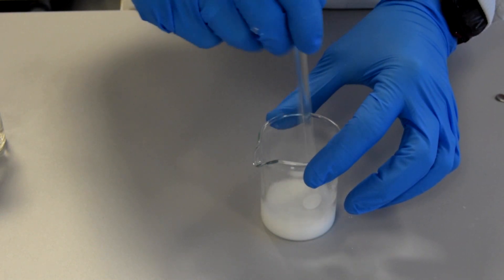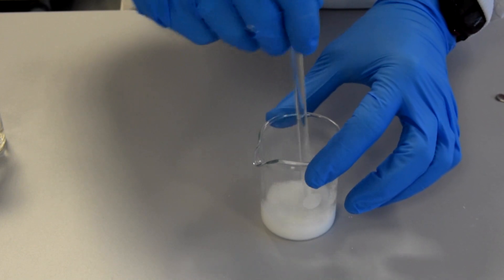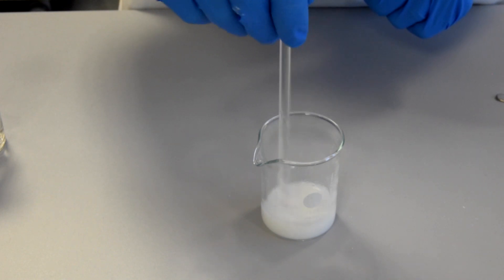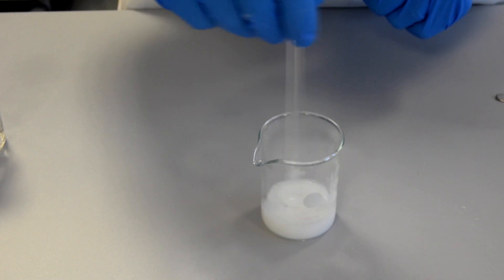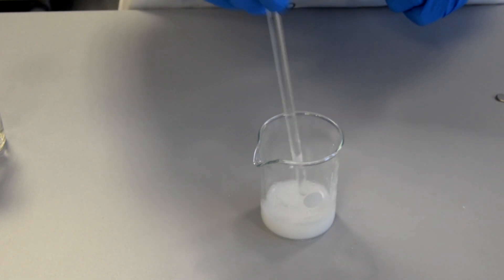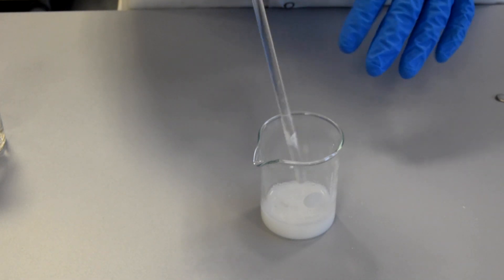We can see now we've got no effervescence taking place, and the magnesium carbonate is now in excess - we have too much magnesium carbonate. All the sulfuric acid has been used up in the reaction, forming the magnesium sulfate. Any more magnesium carbonate added will now remain unreacted.